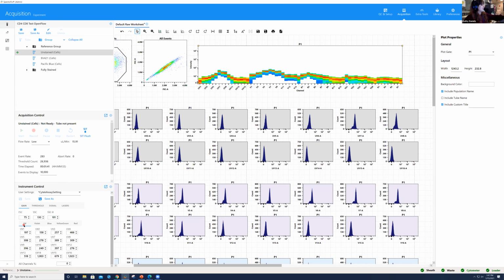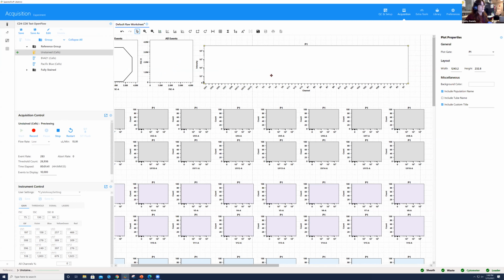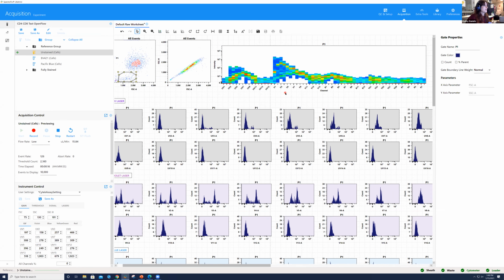So I'm going to put on our fully stained sample that has PAC blue and BV421, okay? Notice that I'm still working from the reference group. I'm not recording anything just yet. All I want to do is run this fully stained to make sure that everything is on scale, and I am going to look in this P1, in this full spectrum plot for that. So when I put this on, I do see signal that's popping up. I can focus in on my lymphocytes if I want, because I do expect to have the CD4 and CD8 population right here, and nothing is off scale. So I do not need to change any of these settings as far as the gains go for fluorescence.